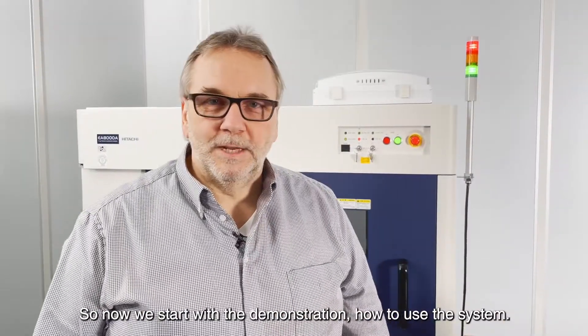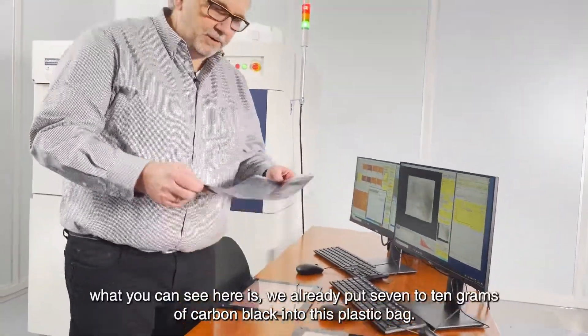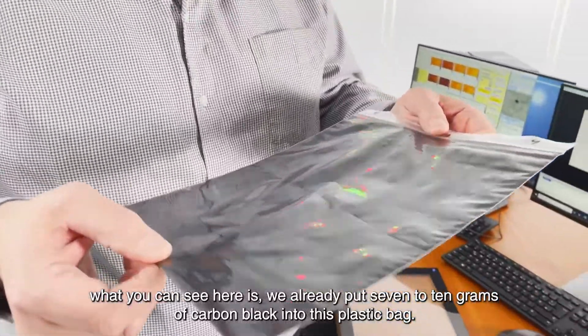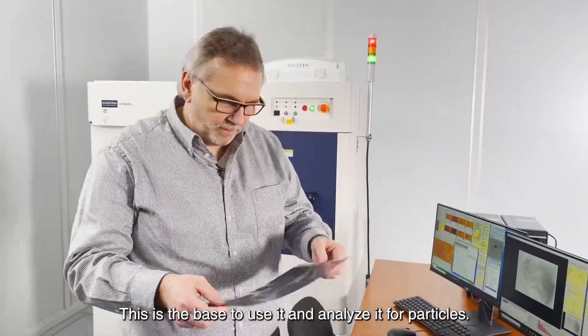So now we start with the demonstration how to use the system. First of all, we need to prepare the sample. What you can see here is we already put 7 to 10 grams of carbon black into this plastic bag. This is the basis to use it and analyze it for particles.